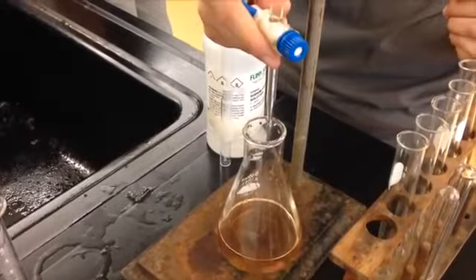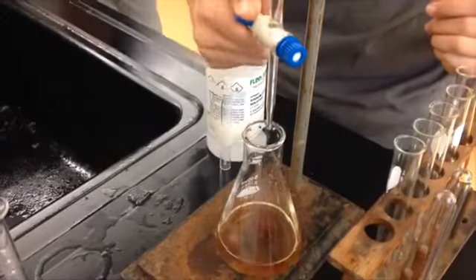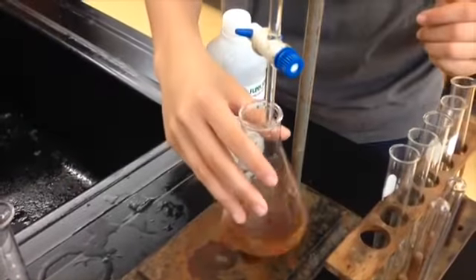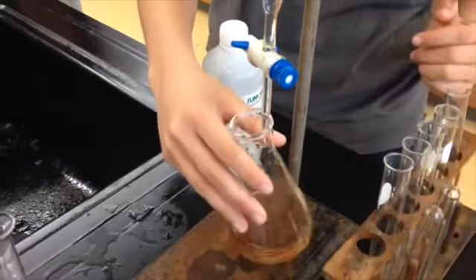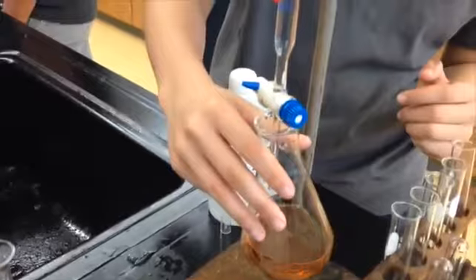Once this occurs, you should start titrating drop by drop rather than milliliter by milliliter to ensure that you don't miss the equivalence point of the titration. We'll explain missing the equivalence point in a minute.